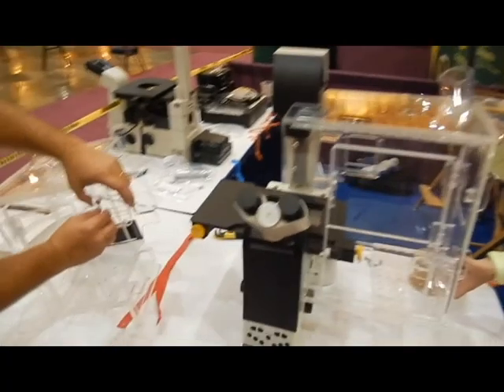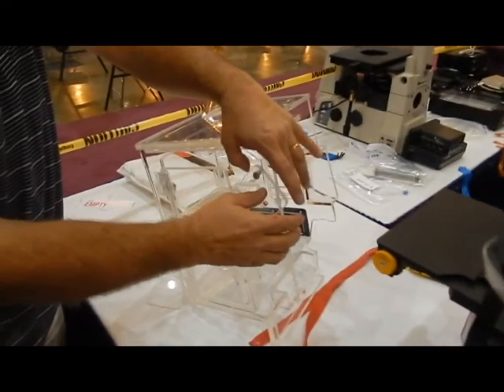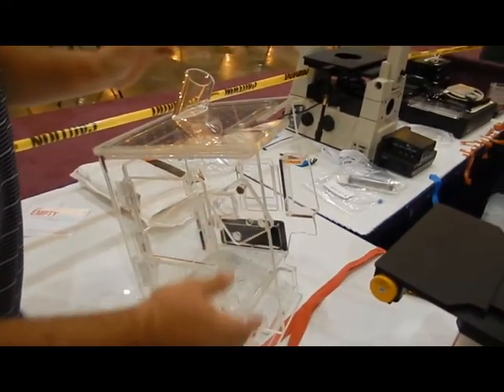Position the square face plate connector over the screw holes on the front face of the left side of the enclosure and install one screw, but do not tighten it.